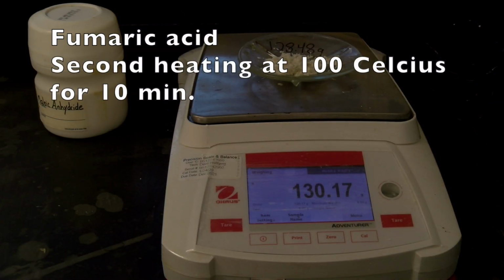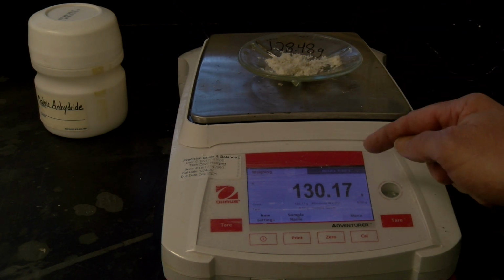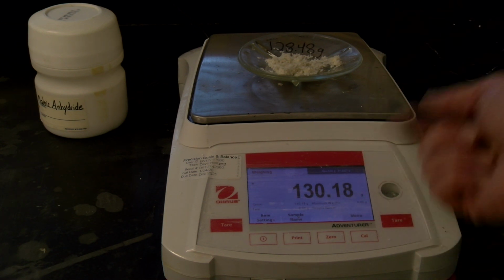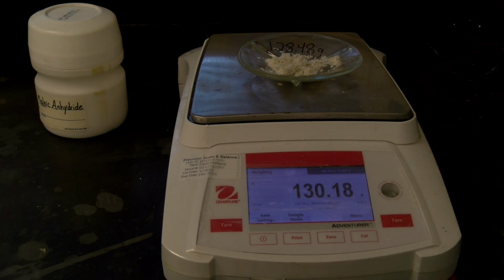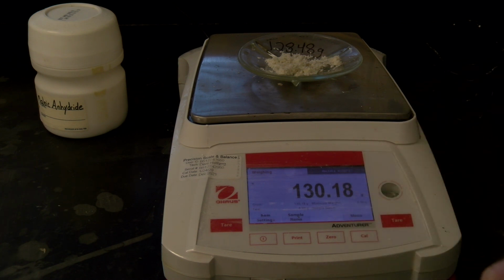Okay, you can see this is for the second product. This is the fumaric acid. Notice the original, after the first heating, was 130.18, and this is 130.17, or 18, it is exactly. So if we go with 130.17 or 18, those both are within 0.05, and so we'll finally call this 130.18.